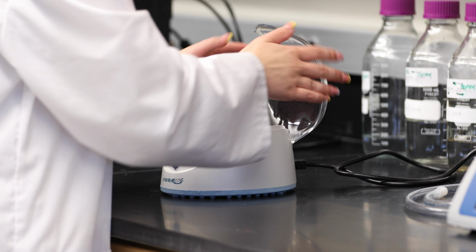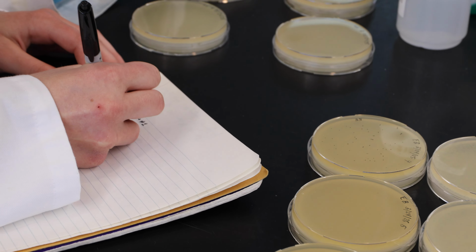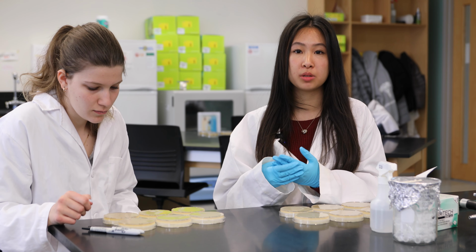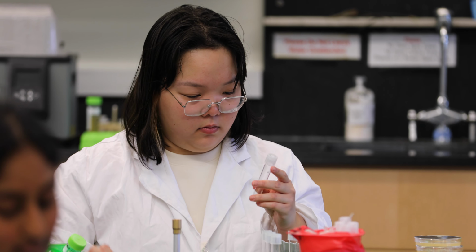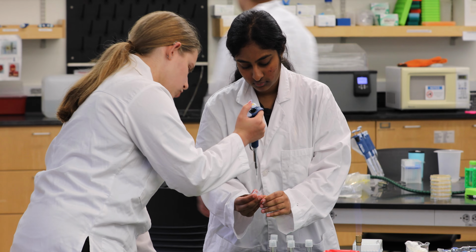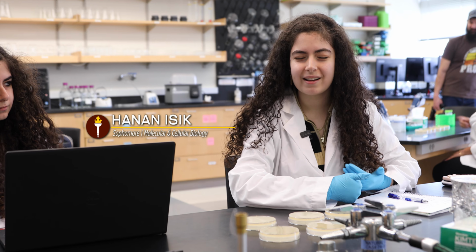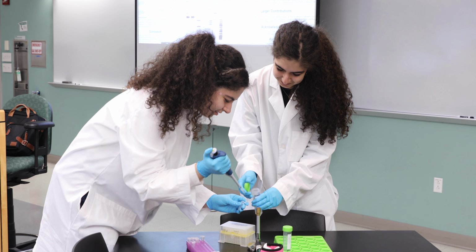It's really amazing because we're able to contribute to the greater scientific community. Yes, we're just college students, most of us are just freshmen here, but it's really amazing that we're able to make such a great impact on something that could help in phage therapy, food production, agricultural, environmental processes. I feel really confident in my research abilities following this class. Learning these techniques, having the confidence to be able to do research like this.